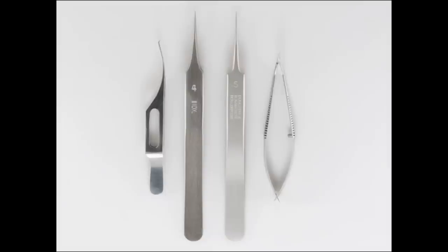It is important to have on hand the right equipment to carry out the dissection. We recommend using quality fine-pointed forceps and scissors. The choice of scissors is very important, and poorly suited scissors will likely damage the specimen. We use scissors with 45-degree bent blades and a 2mm cutting edge.